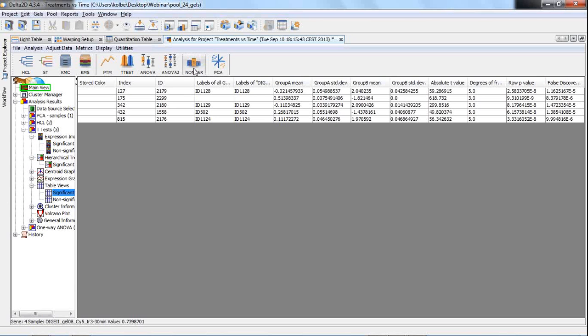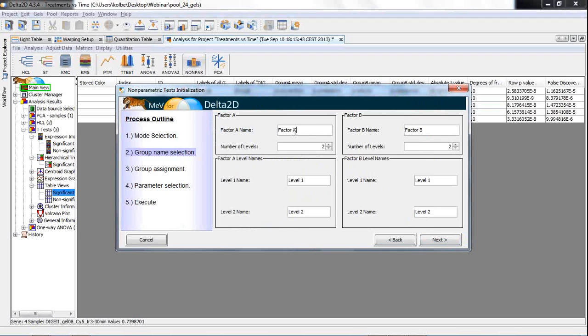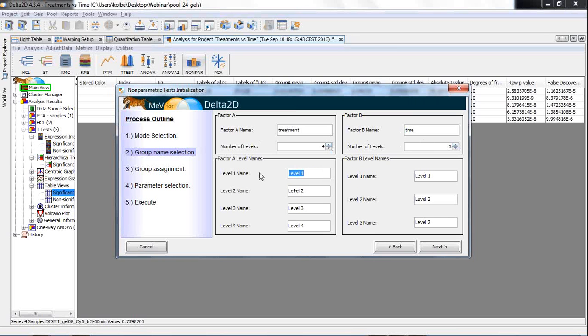Now let's have a look into non-parametric tests. I would like to give a demo of the Mack-Skillings test, which is the equivalent to two-factor ANOVA. I press next, and then we can give the two factors names. I call the first factor treatment and the second factor time, and we have for the treatment 4 levels and for time 3 levels. The first level for the treatment is a control cell line, the second one a treatment 1, a treatment 2, and the fourth a treatment 3 cell line, while the levels of time are 0 minutes, 30 minutes, and 60 minutes.